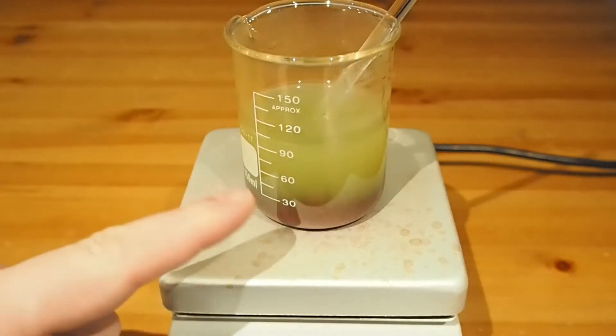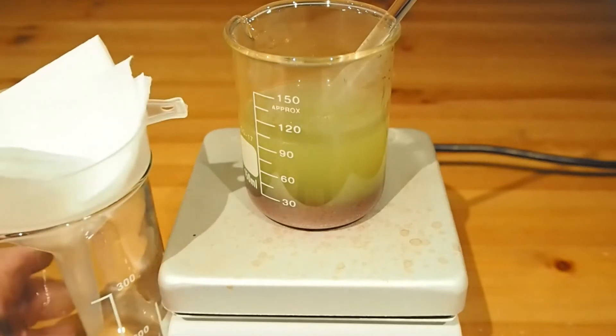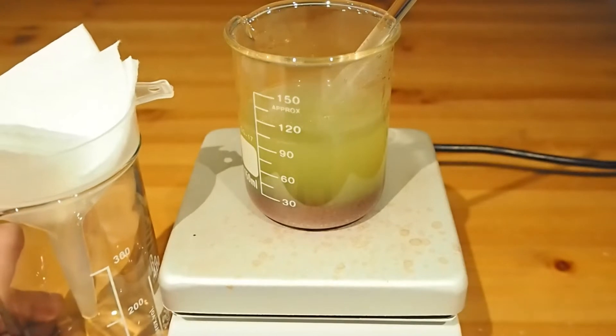So what we've got in here with this green coloured solution is dissolved iron sulfate, and the orange metal below — well that's copper, that orangey red metal. Oh, and this cloudiness — definitely has something in my copper sulfate which isn't very good. So I will get some new stuff after I've used this lot up. But what we're going to do is filter this and collect the filtrate.